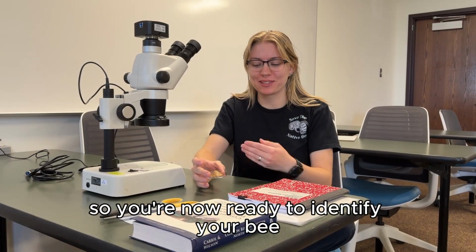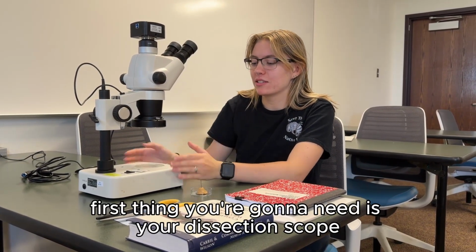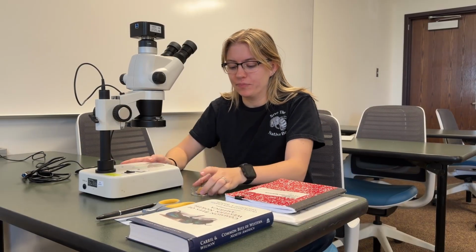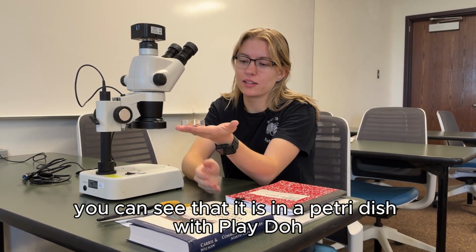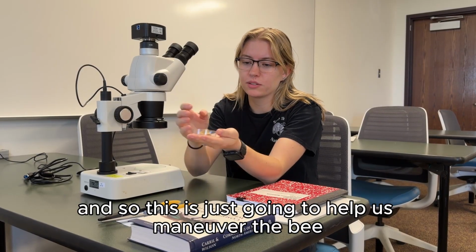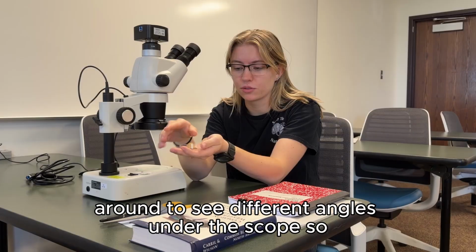So you're now ready to identify your bee. First, you're going to need your dissection scope. Then you're also going to need the bee. You can see that it is in a petri dish with Play-Doh, and this is just going to help us maneuver the bee around to see different angles under the scope.